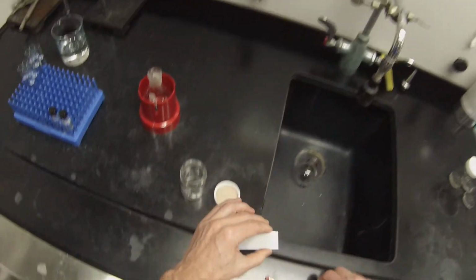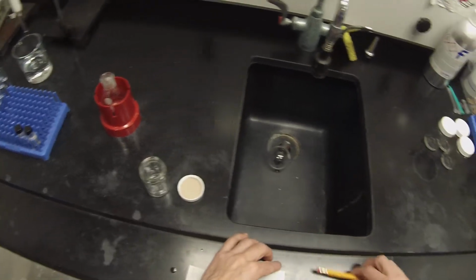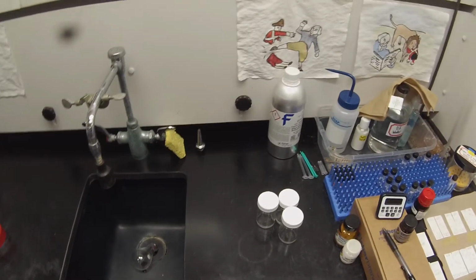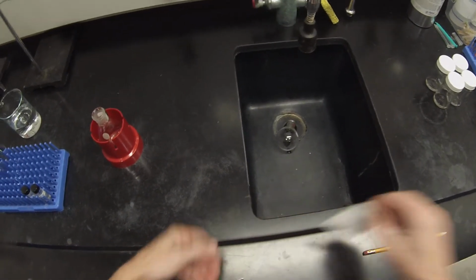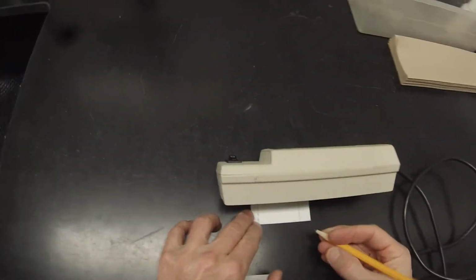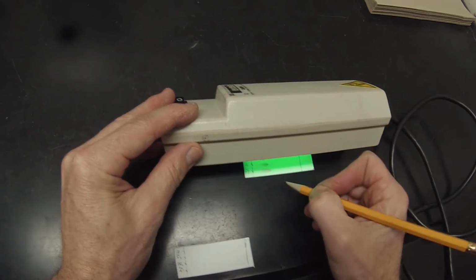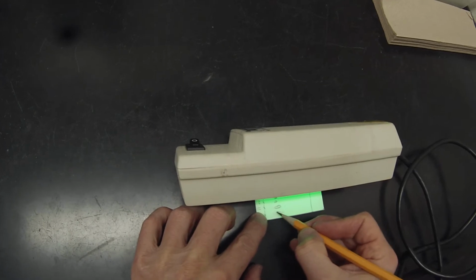This one ran faster than the other one. That's why you mark the solvent front. It looks like fraction 9 doesn't have that top biphenyl spot. Does have compound.